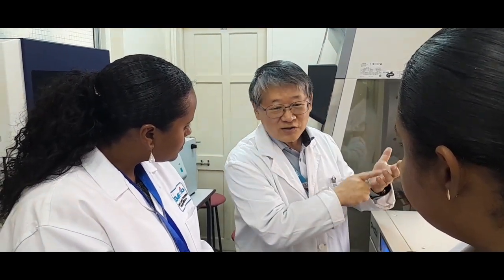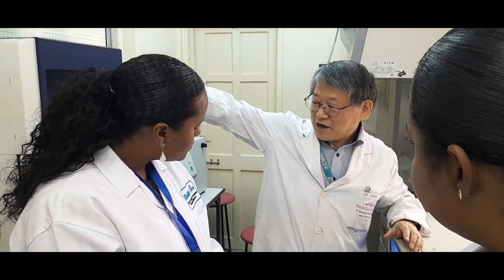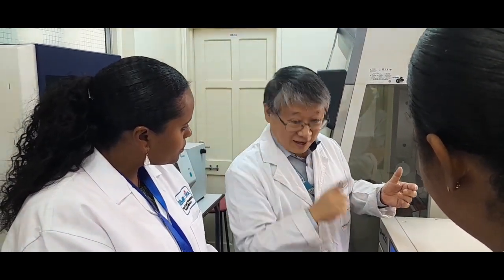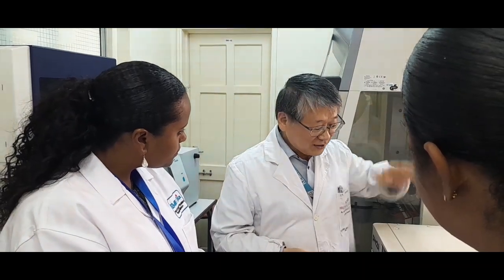But if your required condition is 28 degrees Celsius, like I showed you the incubator for the arbovirus, the insect cells are cultured at 28 degrees Celsius. So 28 minus 5 is how much? 23. Yes, 23 degrees Celsius, right? In your country, sometimes it is above 23 degrees, right? So in that case, the refrigerated incubator can maintain 23 or below, so that your cells can grow nicely.